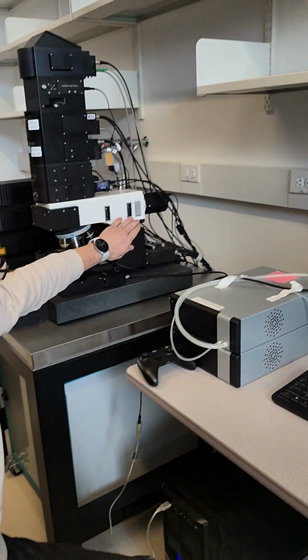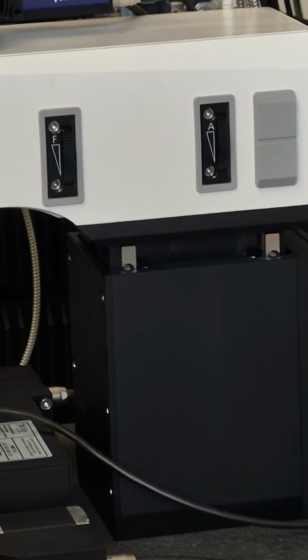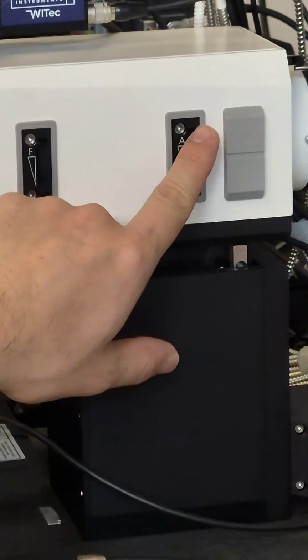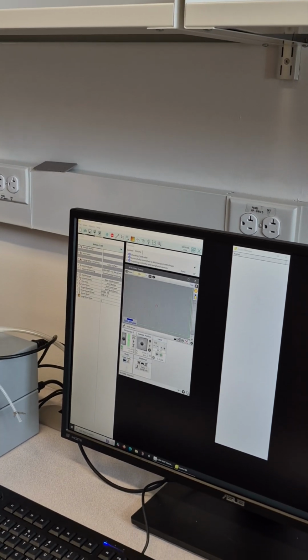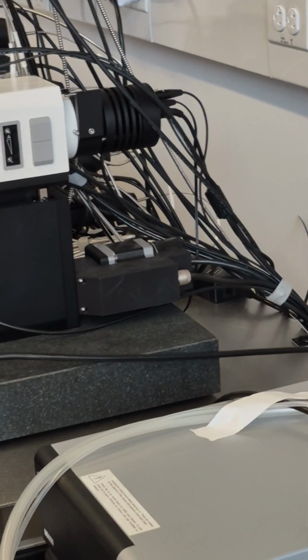Over here we have two operations. You may not need them all the time. This aperture only controls how much light illuminates the sample. Most of the time, you don't need to change it. Right now it's kind of in the middle. If I rotate this wheel, you see brighter and darker. You don't need to change this one. Or sometimes we just make it smallest and we can auto balance. That also works. With the smallest aperture, the illumination is already good enough.